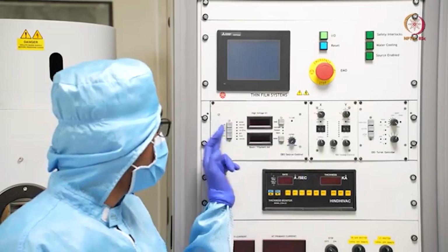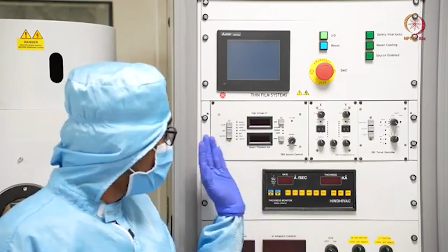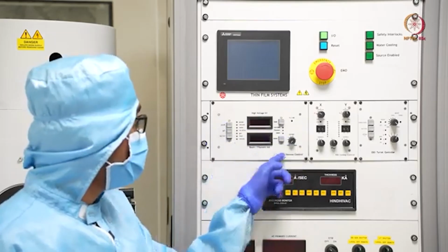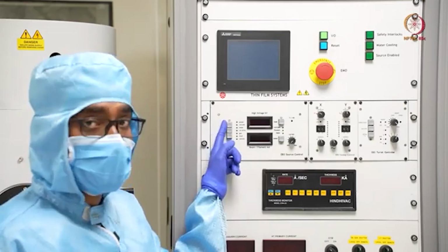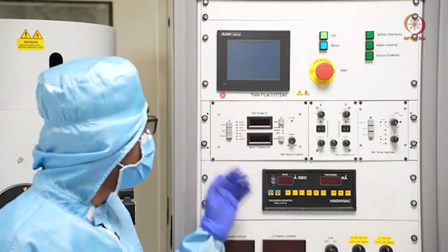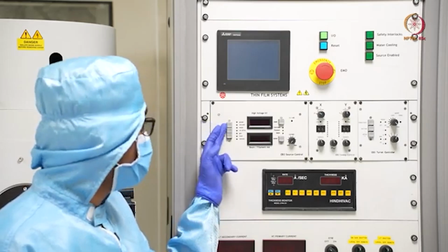And there are other parameters to check whether these are on or not, these are the indicators. Here let us discuss this thing first. So here this is the on-off button, which corresponds to only this much area. So when your transformer is on, like the E-beam transformer, that 5 kilovolt transformer that we have shown, then you can just press it. This is the press button.